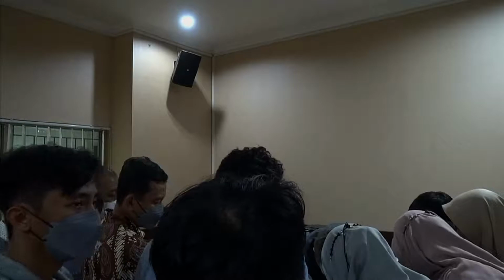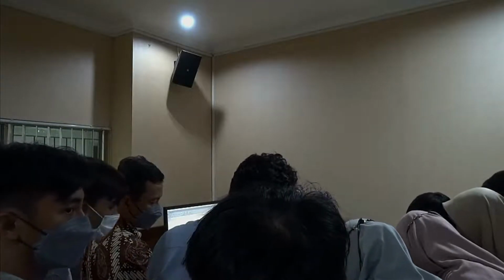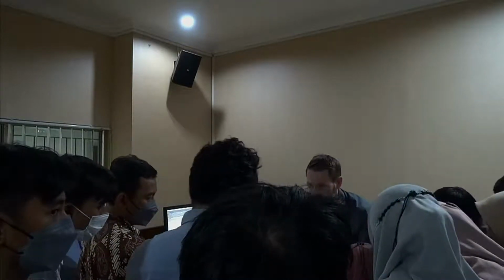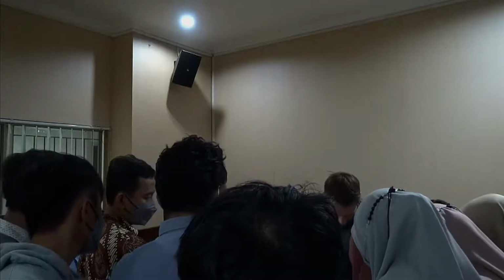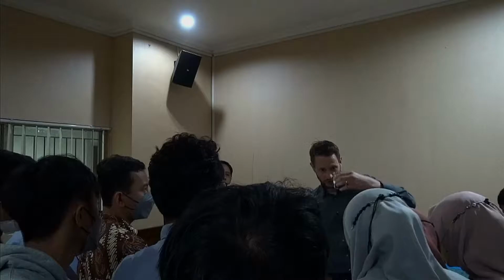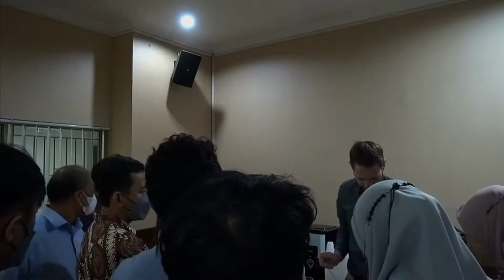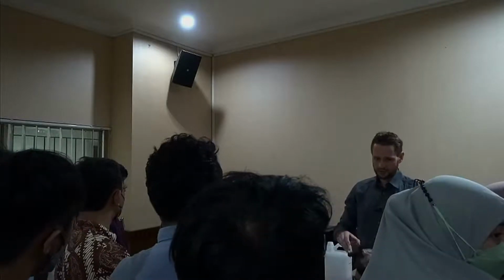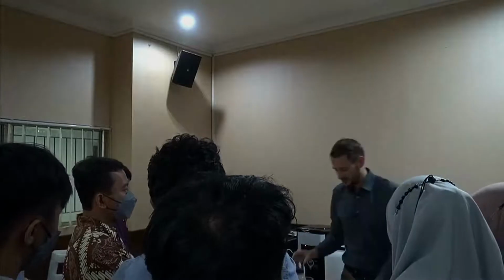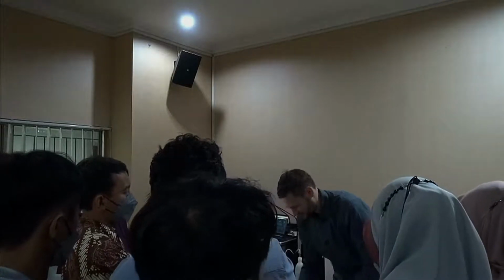Attention, magic moment. Boom. It immediately reduces the surface tension of the water. And now I just shake a little bit, and all of a sudden I have a dispersion. Still on the walls, because I shook it before some material stuck. But as you can see, now I have a dispersion, which I can measure, which can be stable. The downside to this, that's why I'm saying never use this as a first option.